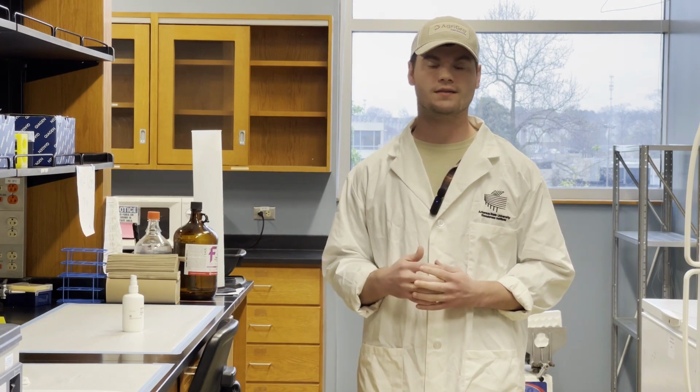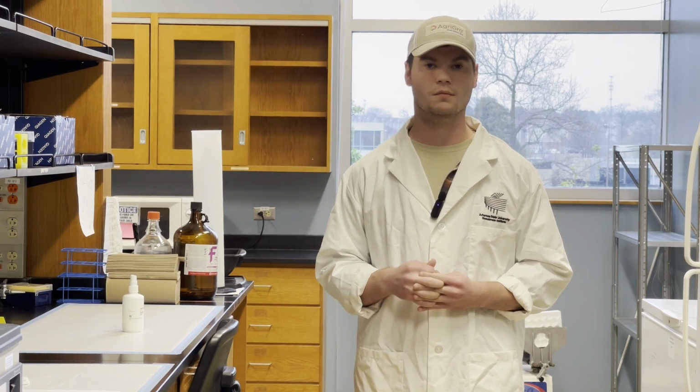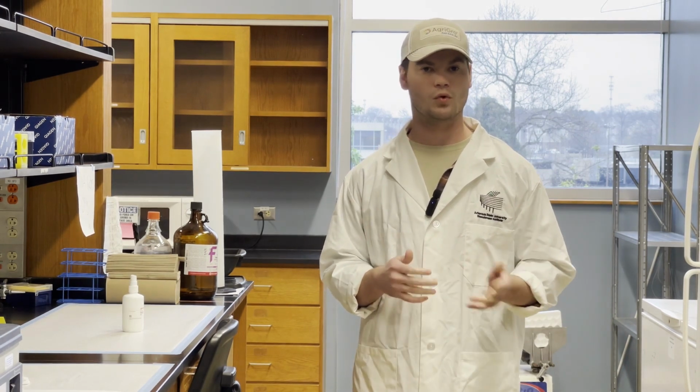We start today by barcoding these samples so that we can individually give them a label or a classifier. So we amplify that 16S gene. It's barcoded with an individual tag per sample. Then we're going to purify that, get just that amplified tagged gene, combine our samples, and then run that on an Oxford Nanopore MinION sequencer. And that's what we're going to show you.